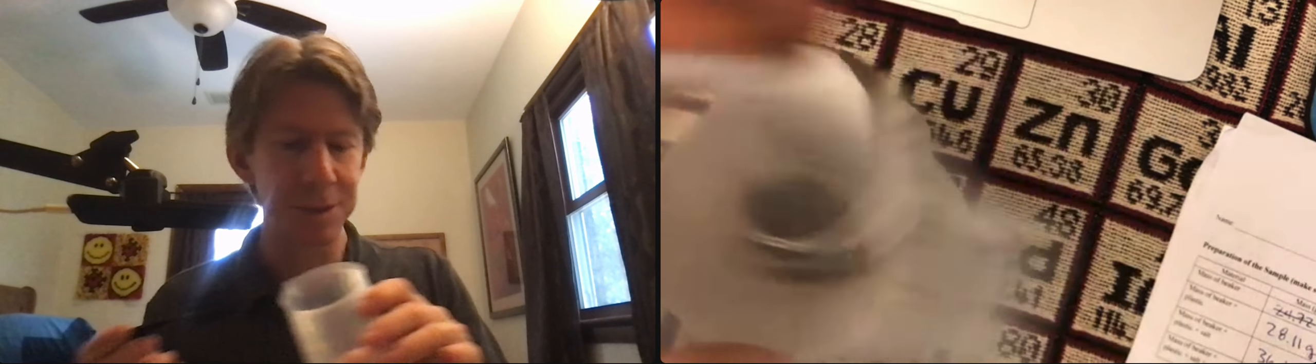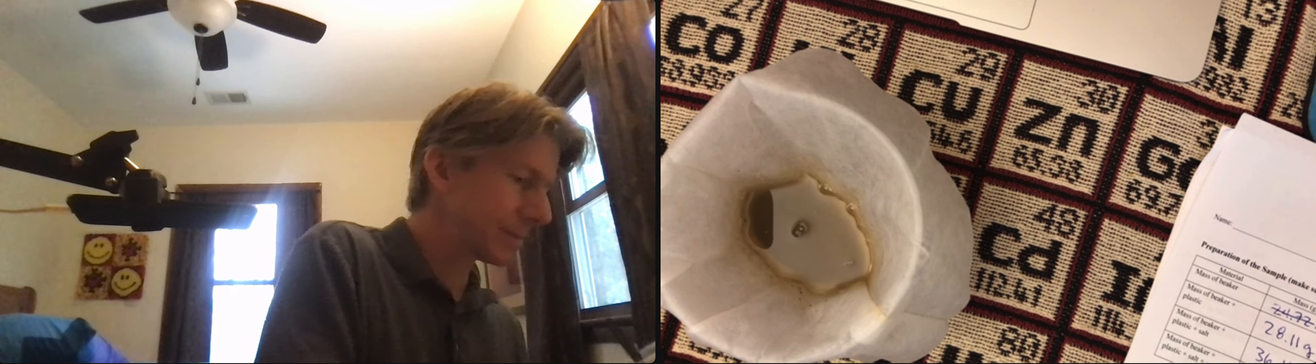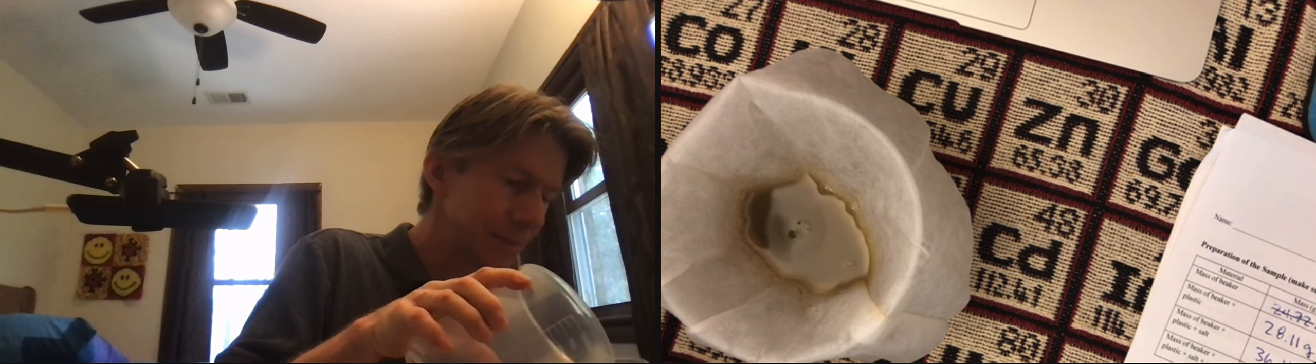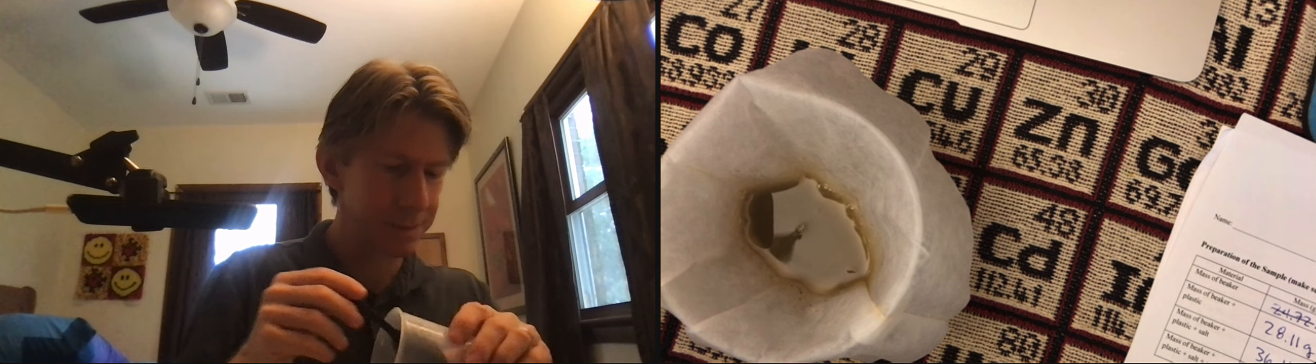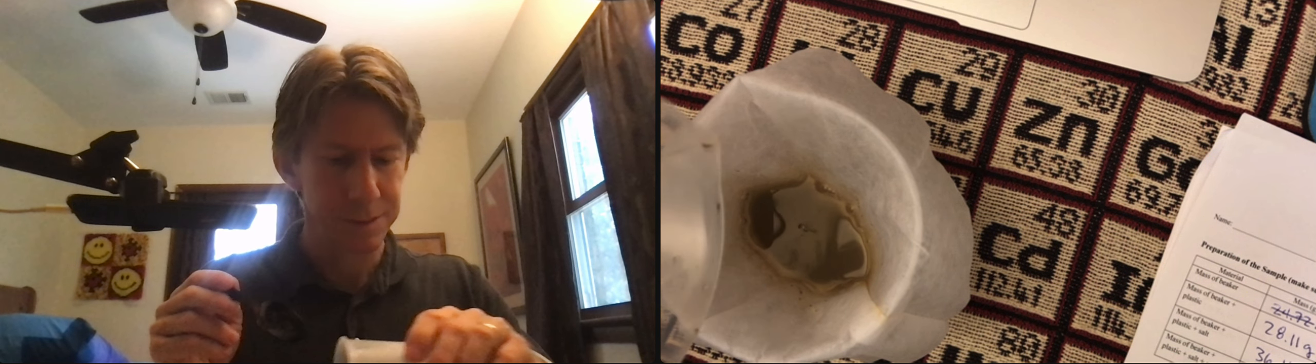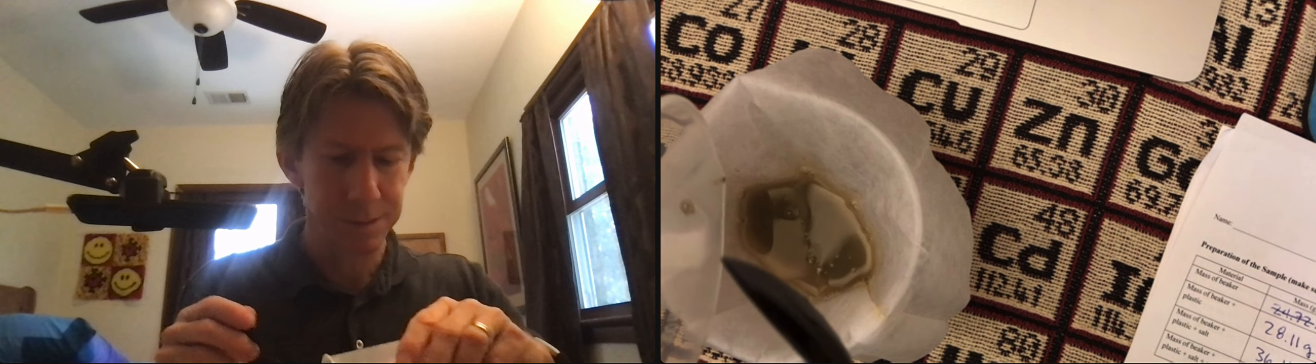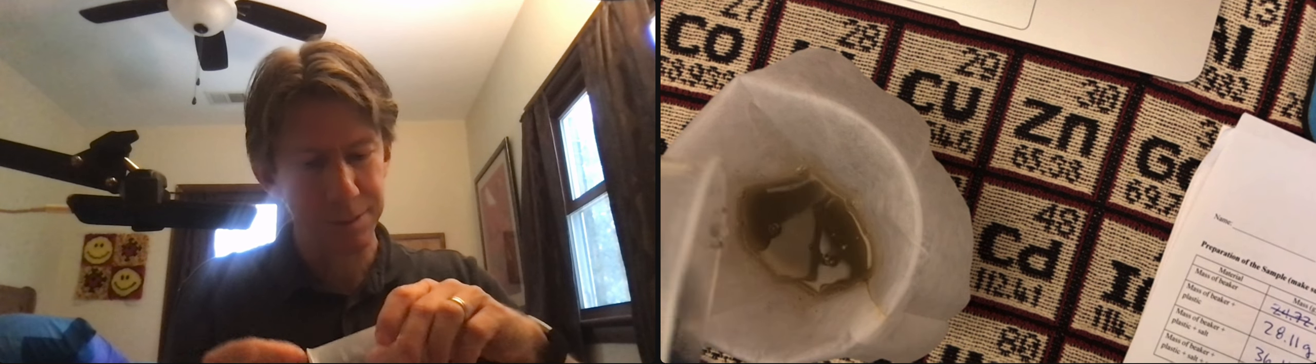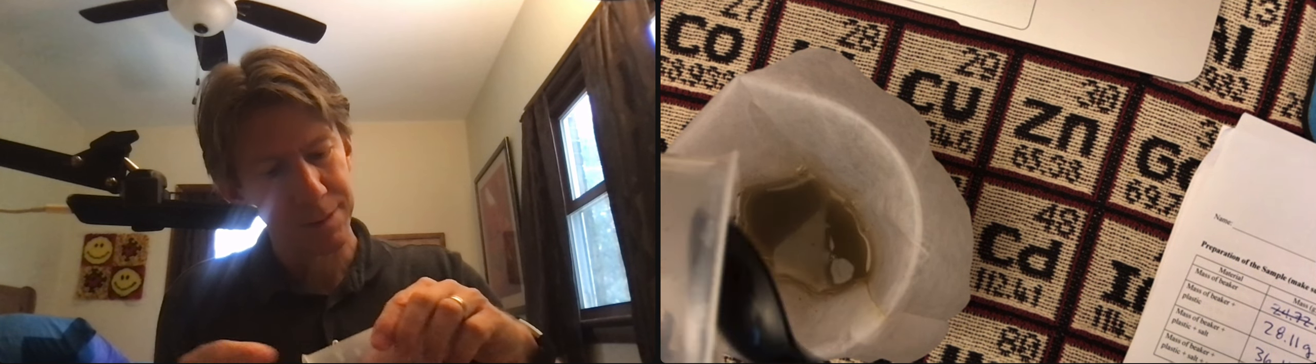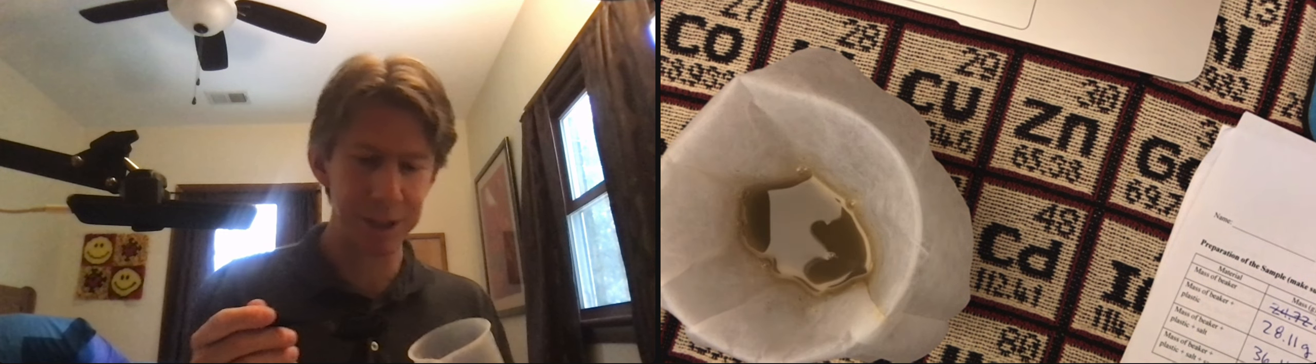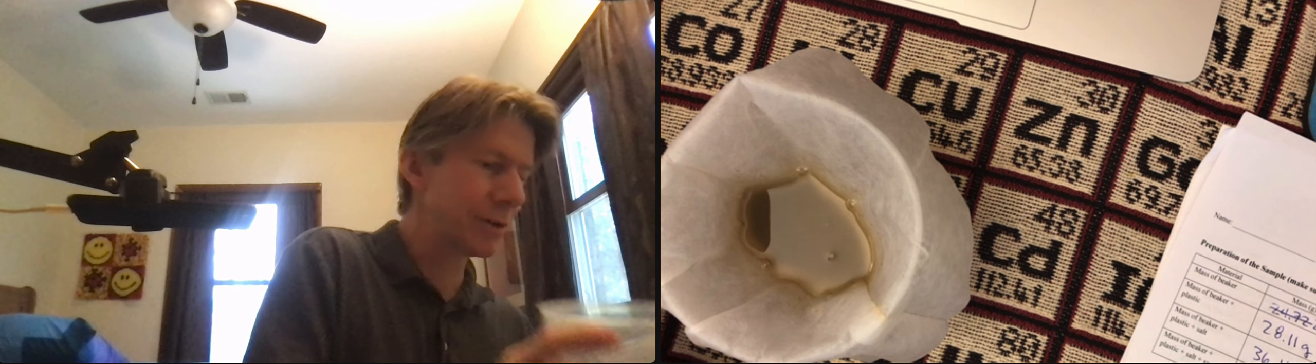And still a little bit in there. We'll do our best. This is the third one. It would be good if we were in the lab and we had an actual squirt bottle so we could squirt it in there. But I'm going to do it a fourth time.